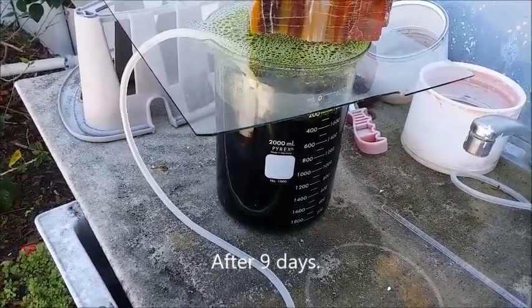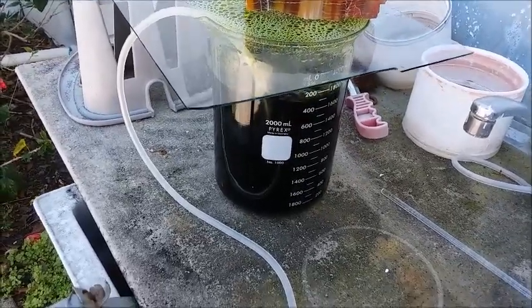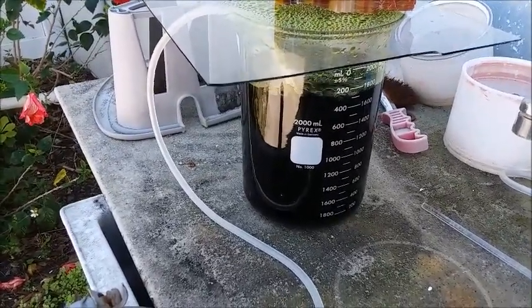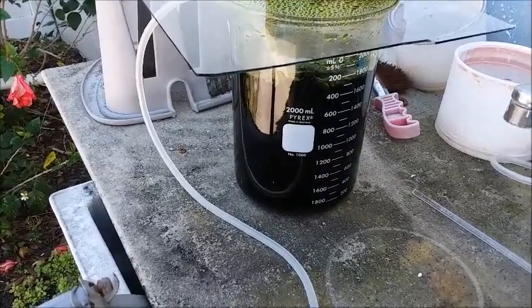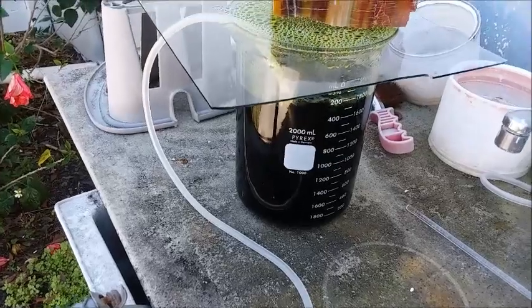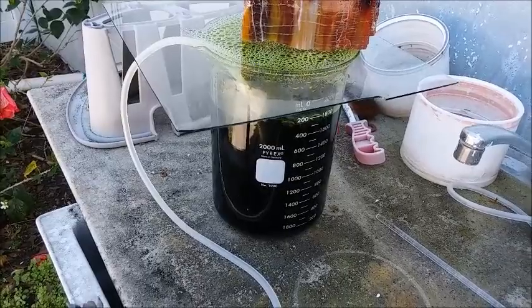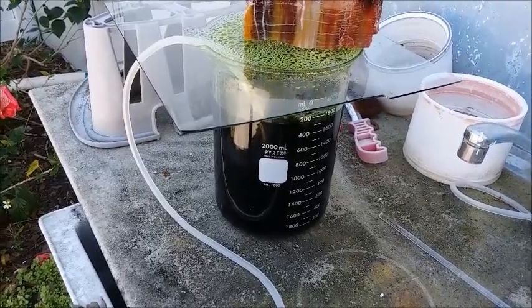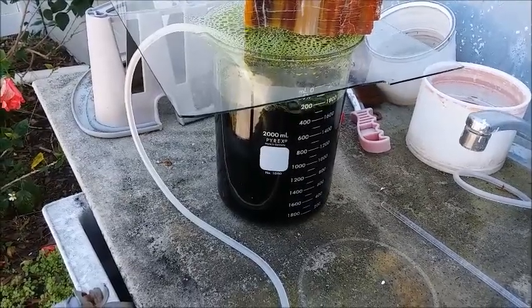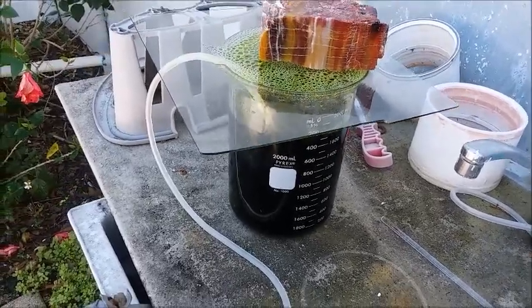This stuff has been bubbling away for a little over a week - I just haven't had time to deal with it, so today's the day. It's been about a week and two days in there and the liquid has gotten really, really dark green - it's almost black. There's a lot of gold floating around in there if I stir it up. I pulled out a piece the other day and looked at it and all the gold was pretty loose, just needed to be washed or rubbed off.